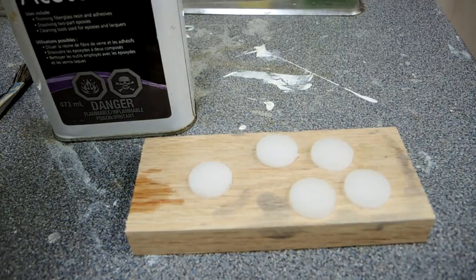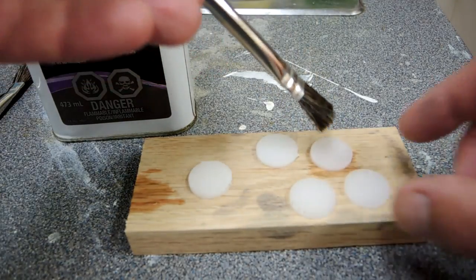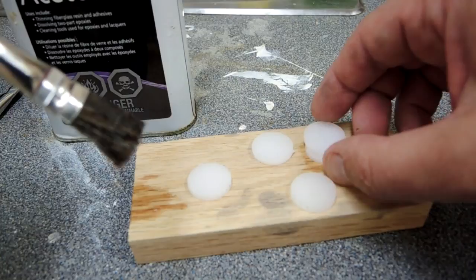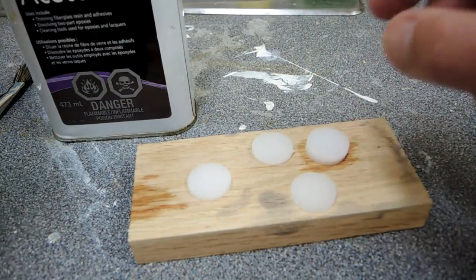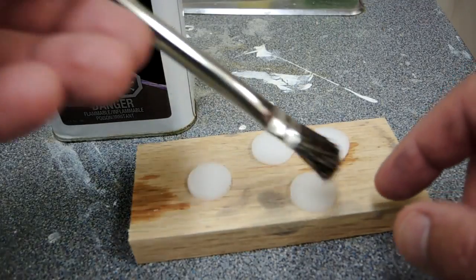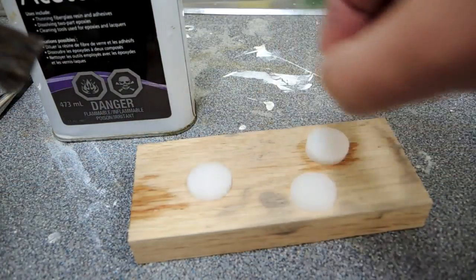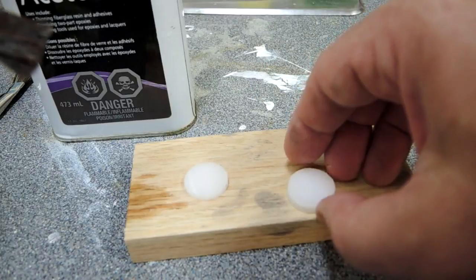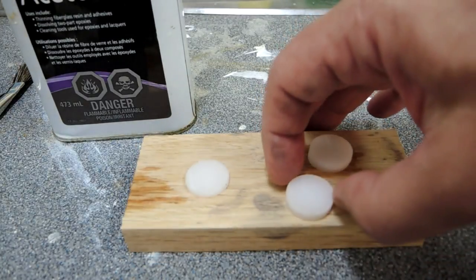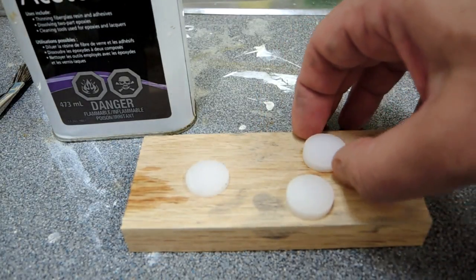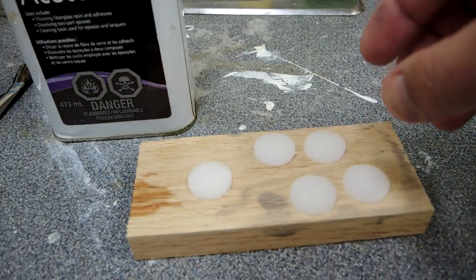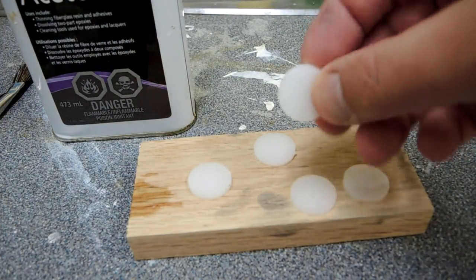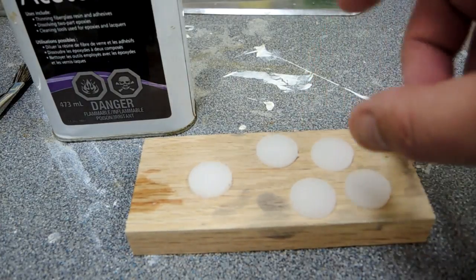The way I did that was to weld them together and truly did use welding. Plexiglass can be affected by acetone, basically dissolves and you can take advantage of that. So I essentially painted acetone onto the disc and then stacked them up and that was important because I wanted a void-free finish which was optically clear and this works really well. It's a really solid technique. So once that dried up, essentially I have the assembly.